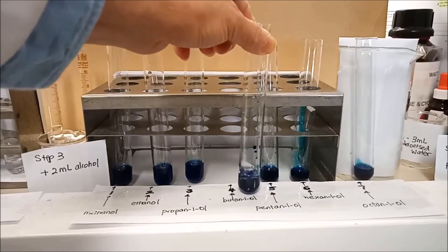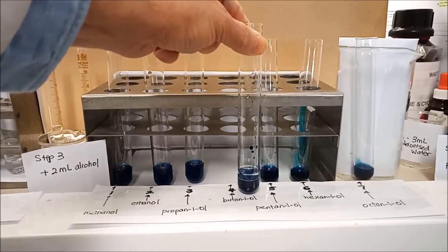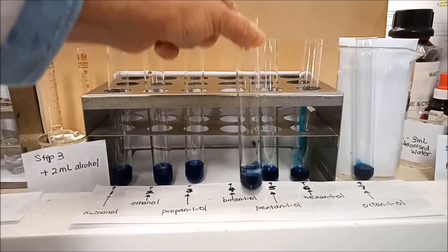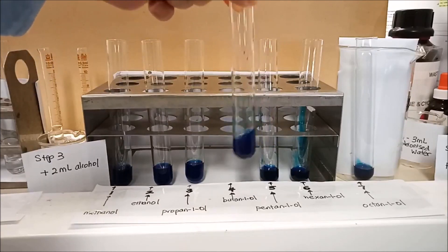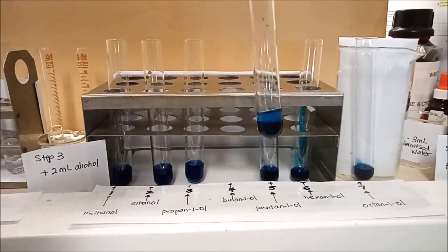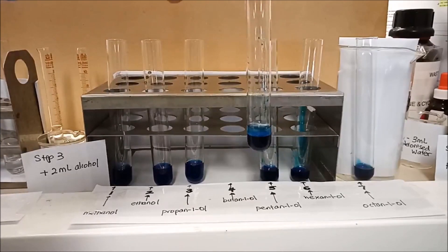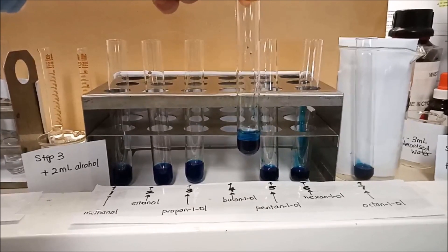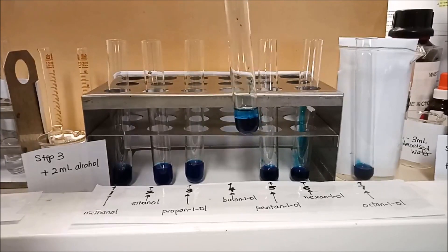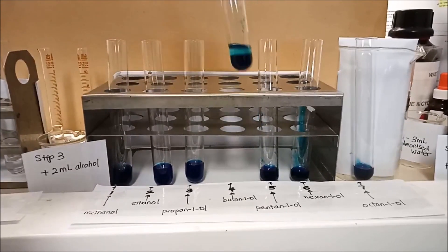The top layer is less dense butanol. The bottom layer is water. And try to give it a shake and see what happens. Again, it didn't separate very well. You can see the dark blue which is the water, and the light blue is our butanol.